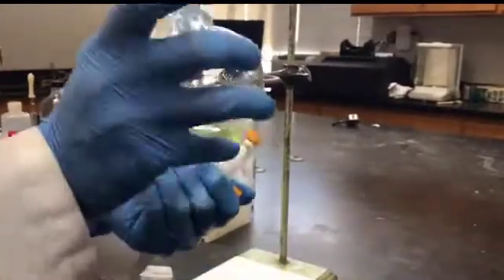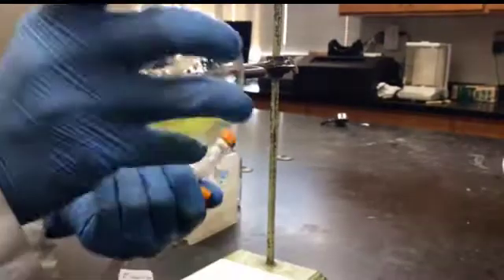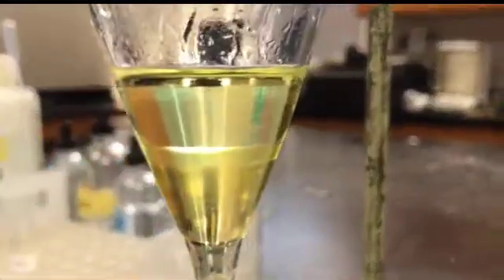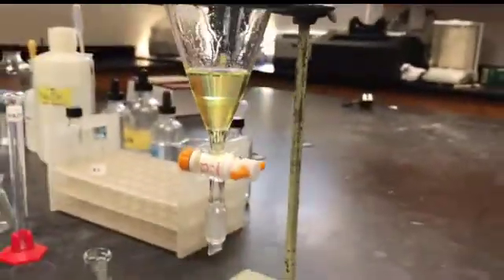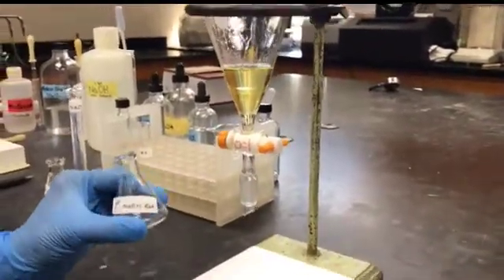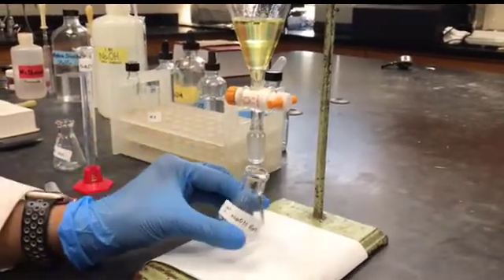Actually separating out the layers, shaking the funnel for the extraction. Now the layers are separated. I shook the funnel for 30 seconds and I let it sit for some time, and now you can see the layers are completely separated. Now I'm going to remove the lower layer into this Erlenmeyer flask labeled first NaOH extract.